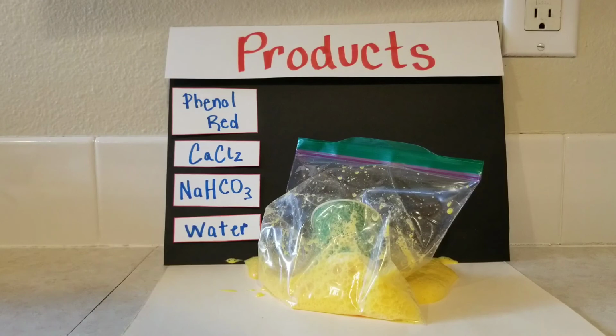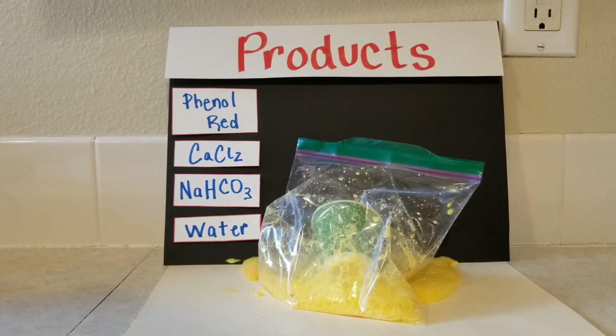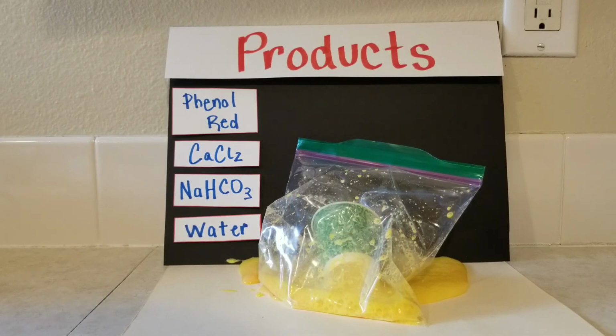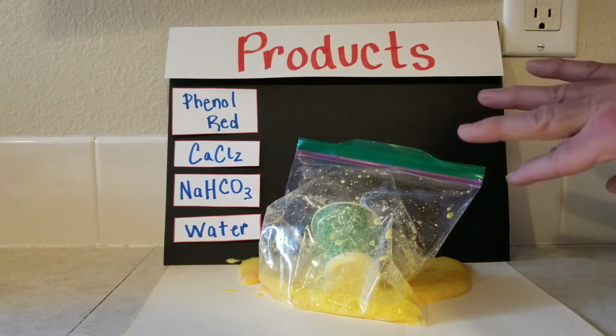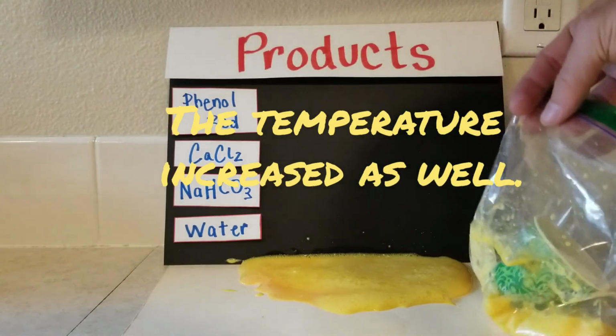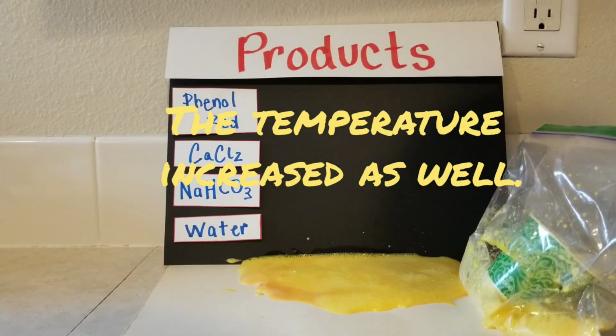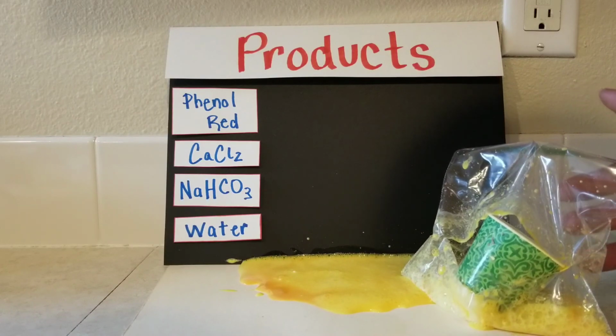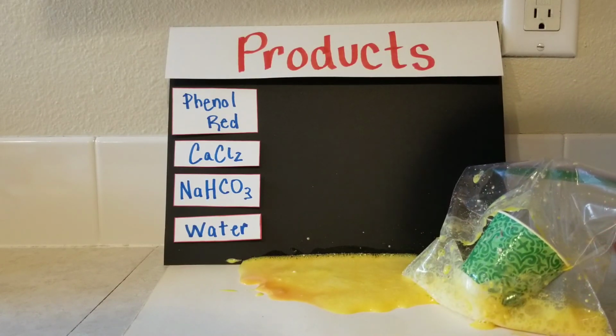I think it may have produced a little bit of gas. So those bubbles that we're seeing are the production of a gas. We also can see that there's a color change that took place. So putting down the information into your products, whatever it is that you see as a property of our new substance.